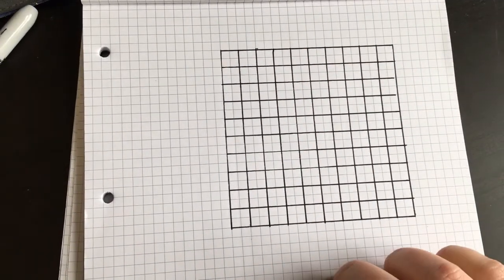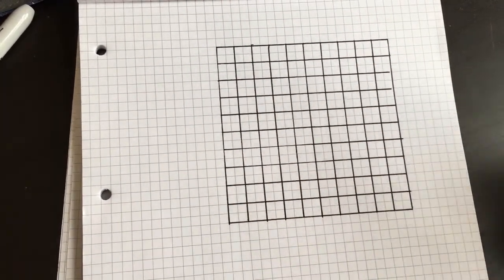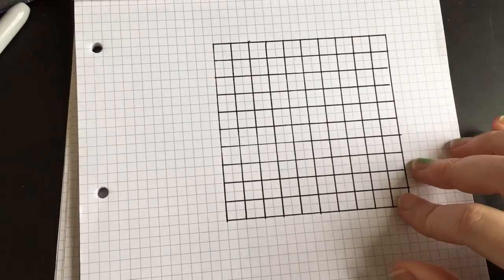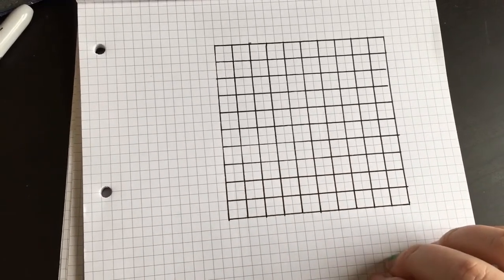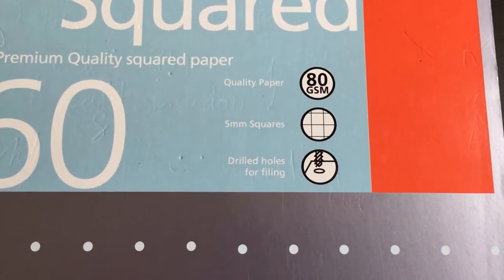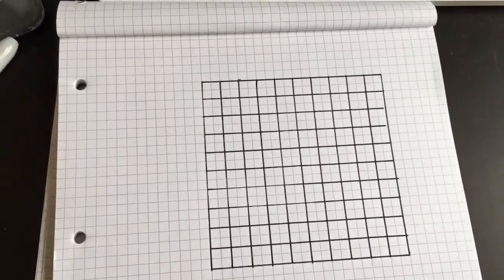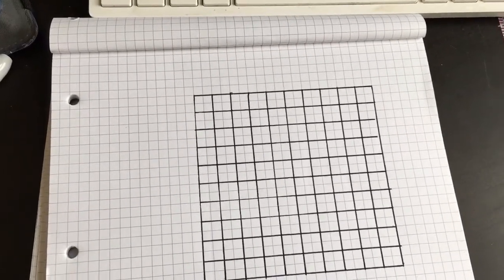The reason I've used squared paper here is because I then don't have to measure any angles, as the squares are already there. You can use graph paper or squared paper. This particular squared paper has written on the front 5mm squares, so I don't even have to measure it. However, obviously you can get a ruler and actually measure it yourself.